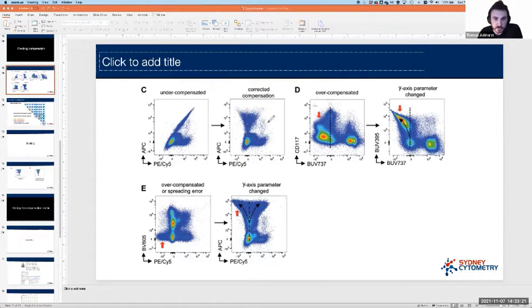The second situation we'll come across is overcompensation, which, as you would imagine, is the opposite problem. The signal has been moved too far out of the non-target detector. In this example, the way we might come across this is as follows. If we're looking at where the 0 is here, which is where this dotted line is, we're seeing these events which we'd call super negative. They're way, way below the 0. And this is a red flag. This is like, okay, there's something going on here that we need to deal with.